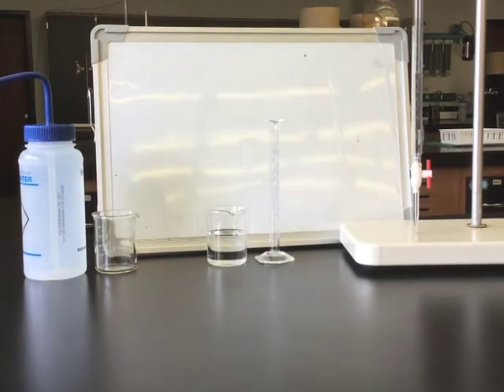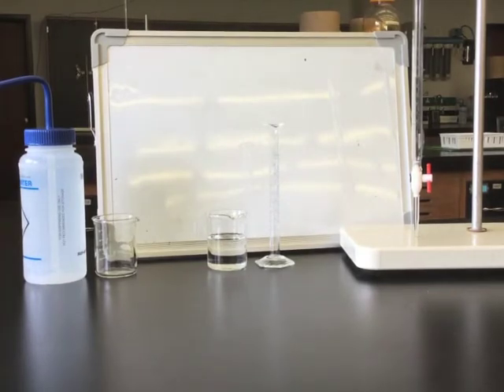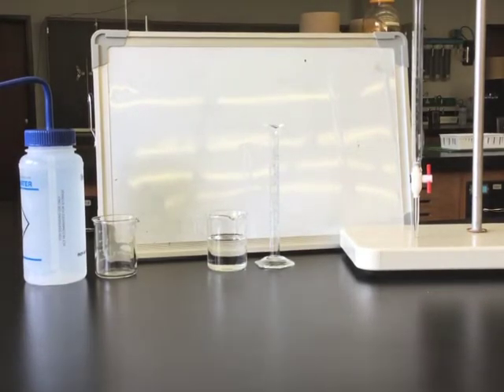In this week's lab, you will be finding the density of two liquids. One will be deionized water and the other will be an unknown liquid.